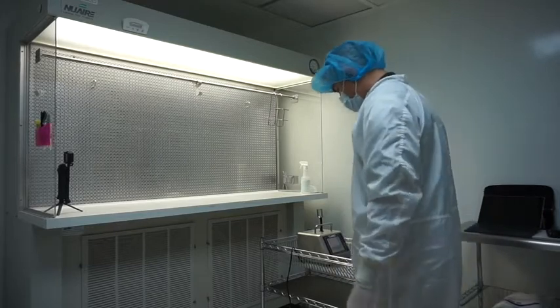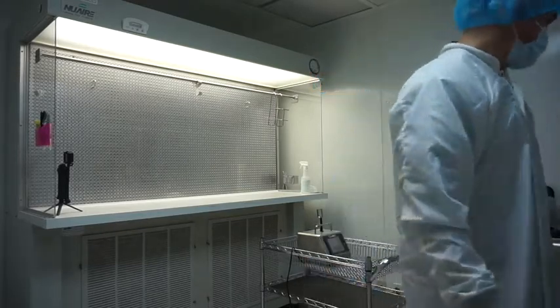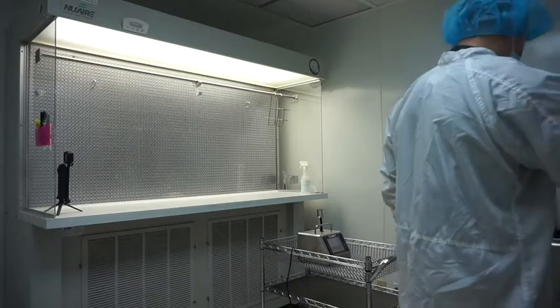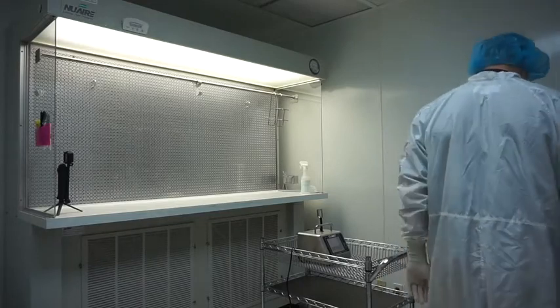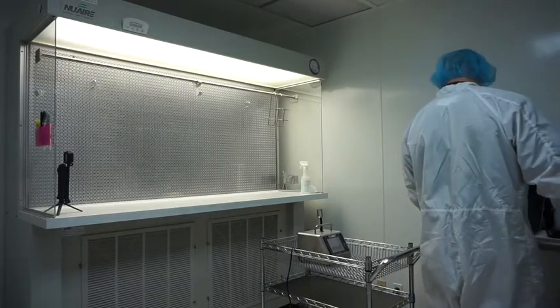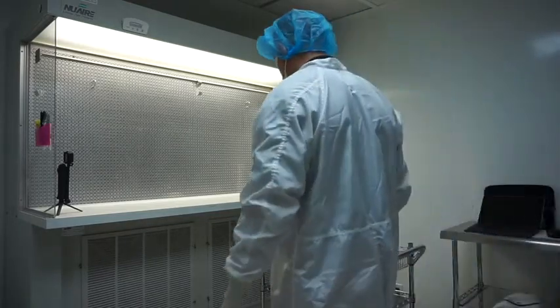What you want to do is set up your counter on a mobile cart at least at the work surface height, which is 36 inches.